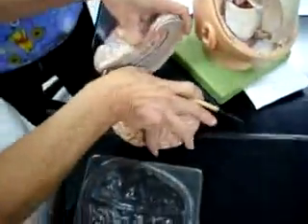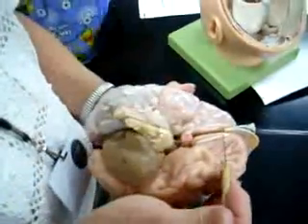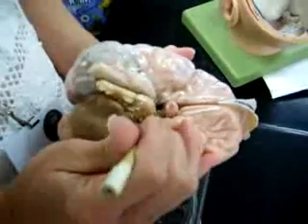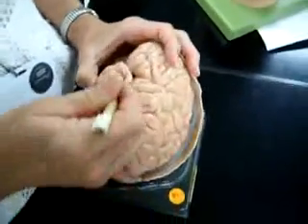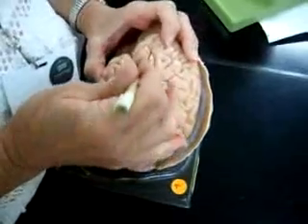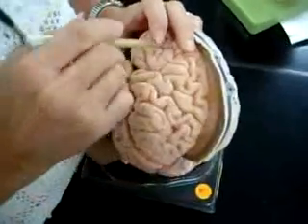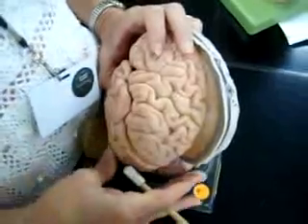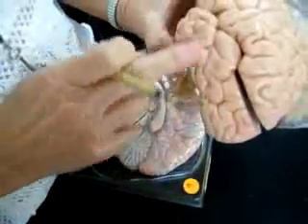If we put the two halves of the brain together, you see olfactory bulb, olfactory tract. You see optic nerve, and where it intersects the other side is the optic chiasma. You see lateral fissure. You see a sulcus, a superficial groove. You see a gyrus, an outfolding. You see a division between your frontal lobe and your parietal lobe right here, which is called the central sulcus or fissure of Rolando. This lobe back here would be your occipital lobe. This is your temporal lobe.